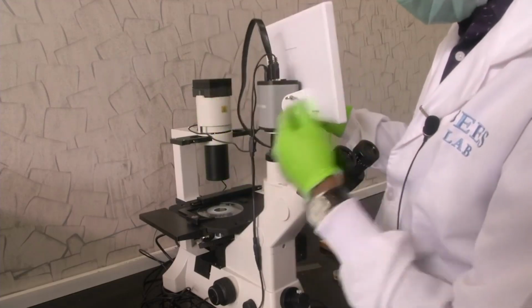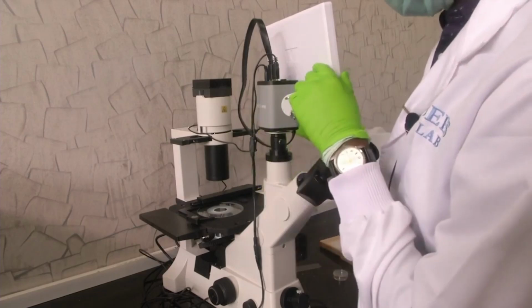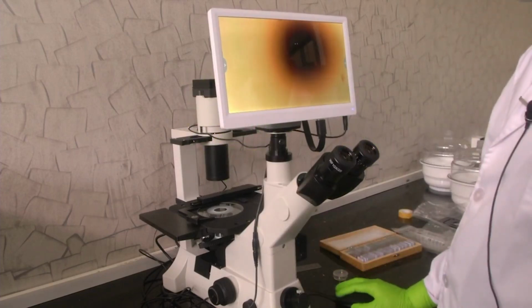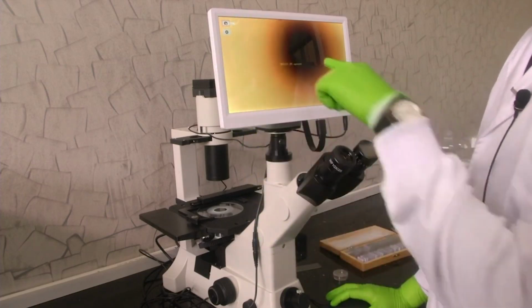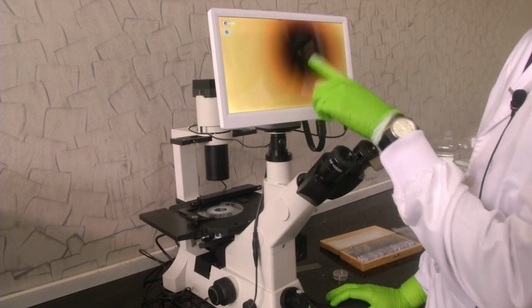So, this camera will capture whatever the eyepiece is showing and it will show it on the display. So, this is the display. I hope you can see it. Now, we have a mouse. With that mouse we can move around, and you can actually capture the images. If you come to the bottom, see photo, if you click photo, it will capture this image. See, image is captured, image 18.jpg captured.